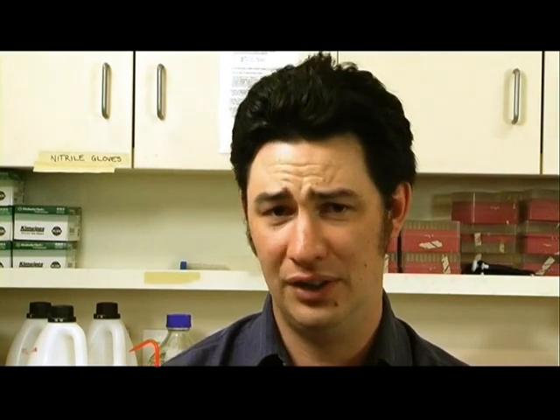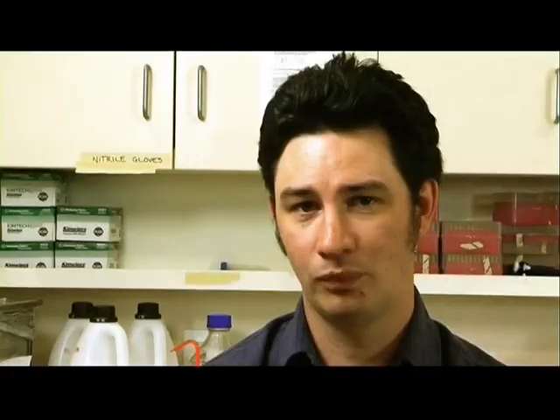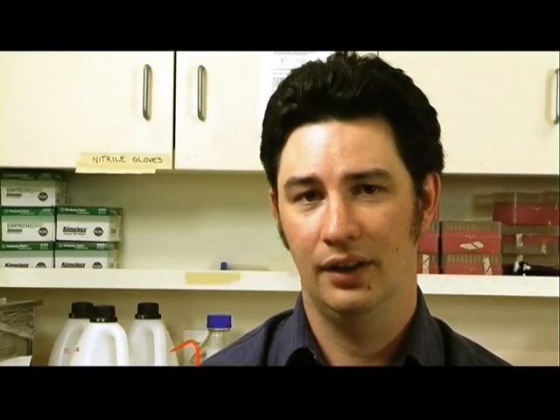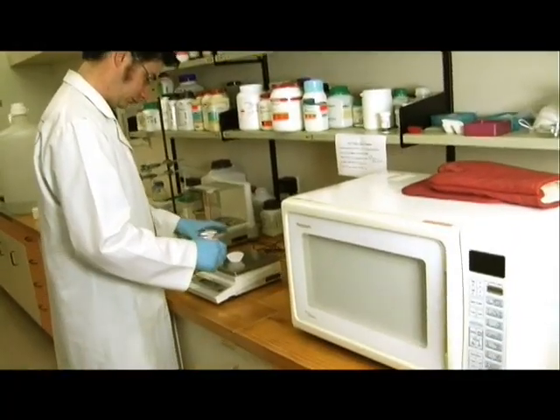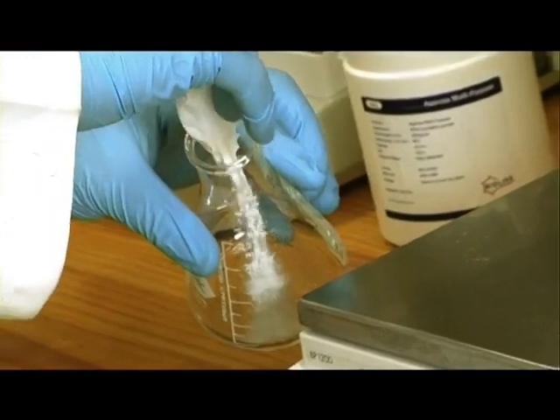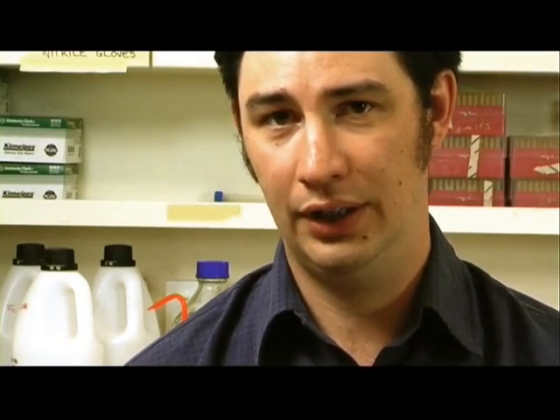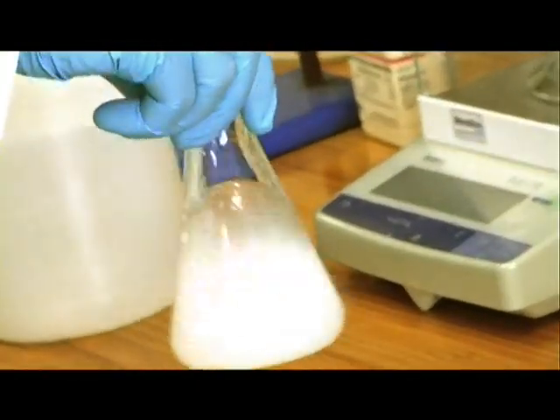Electrophoresis is a method for separating and visualising protein, RNA or DNA molecules based upon their size and charge, using electrical current and a gel matrix. For this, we will need to make a gel medium. We will be adding agarose powder to electrophoresis running buffer to make a final solution of 1% agarose. Different amounts of agarose can be added to produce a more or less dense gel. A more dense gel will be better for separating very small DNA fragments, and a less dense gel will be better for separating very large DNA fragments.